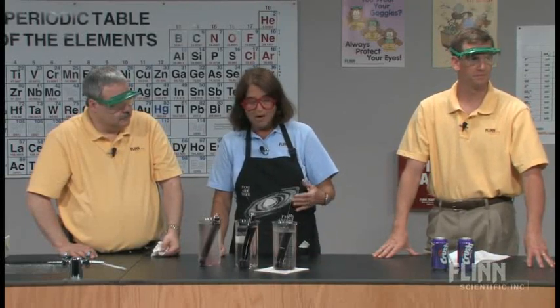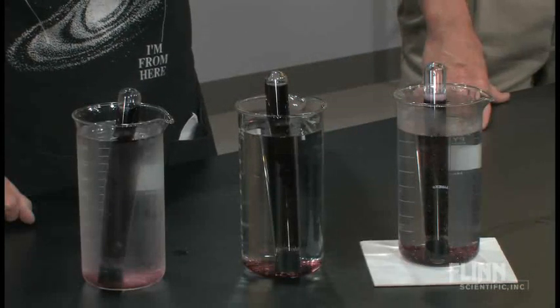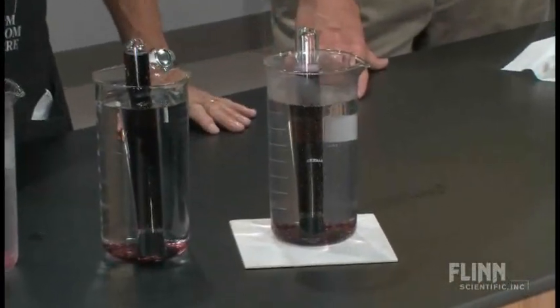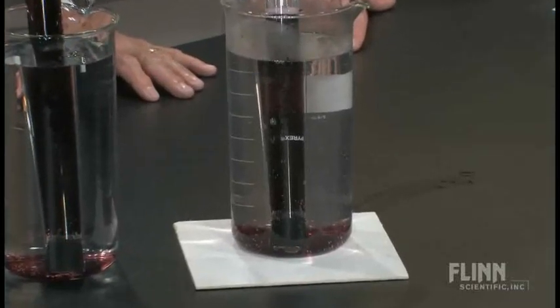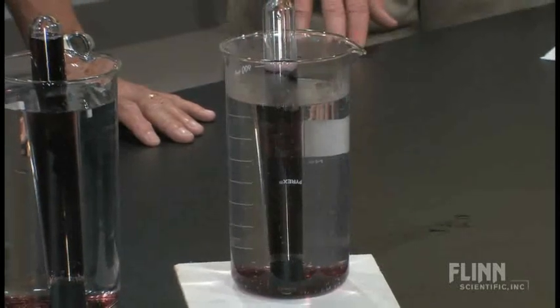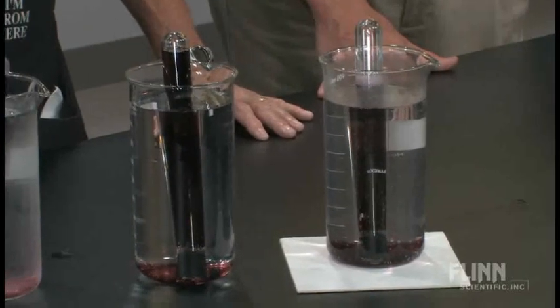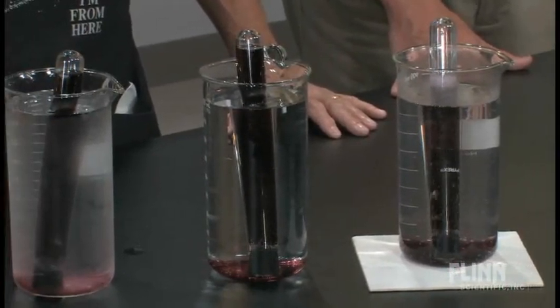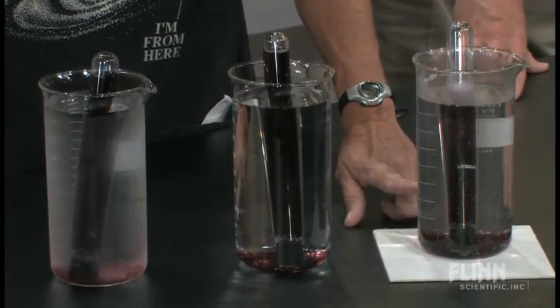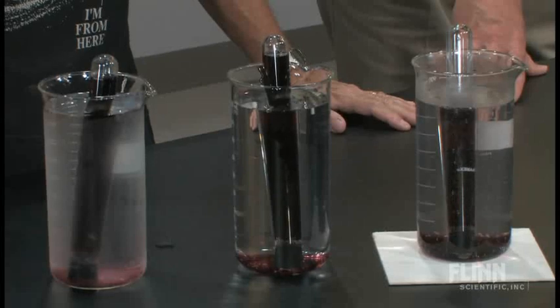As far as looking at the motion of the gases, this one's definitely moving a lot faster when it's in the hot water. You can see the grape crush coming out of the bottom and the level inside the test tube moving lower and lower. If you zoom in on the hot solution — the third beaker — look at the number of gas bubbles you can see escaping along the sides.